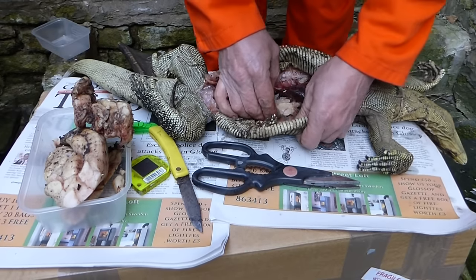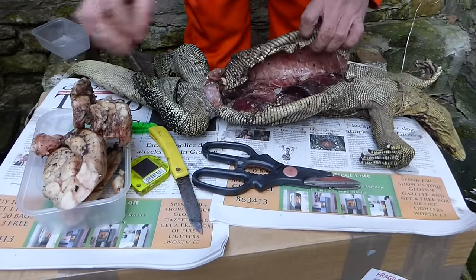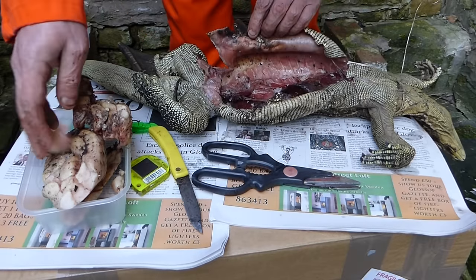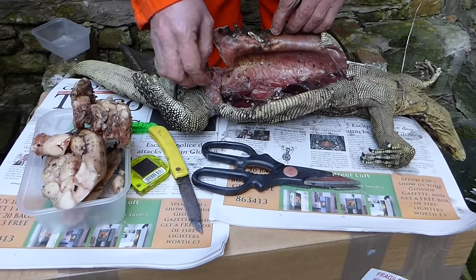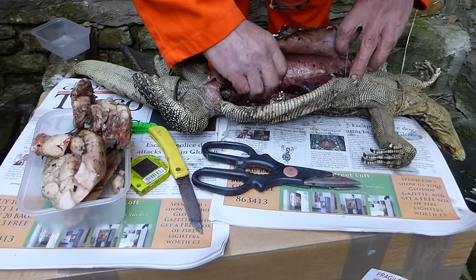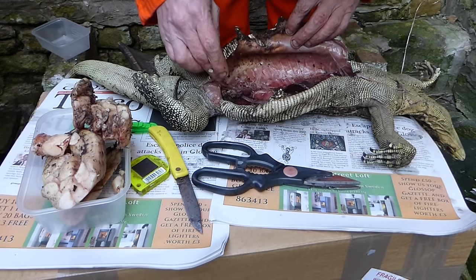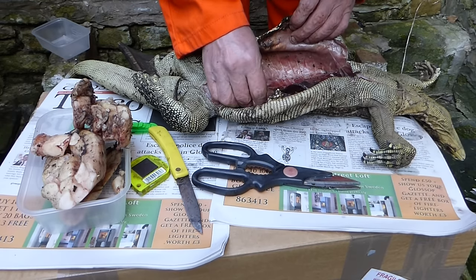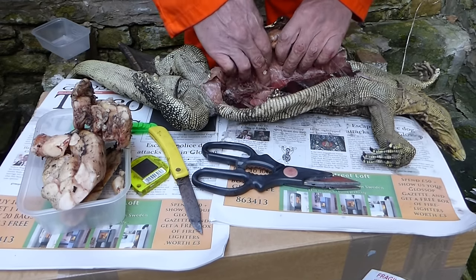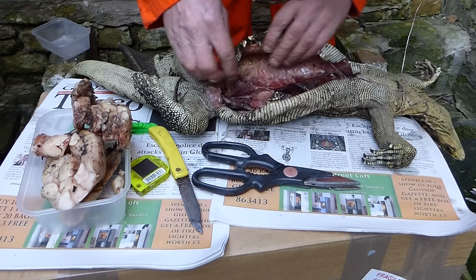There's more fat stuck here. You might prefer not to use your fingers for stuff like this. Goodness, there's not much left now we've taken all the fat out. That is basically the body cavity — strips of fat. Everything else is quite frozen in there. You should really be able to see everything.